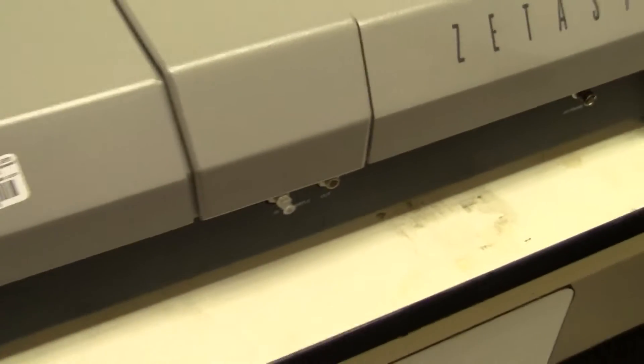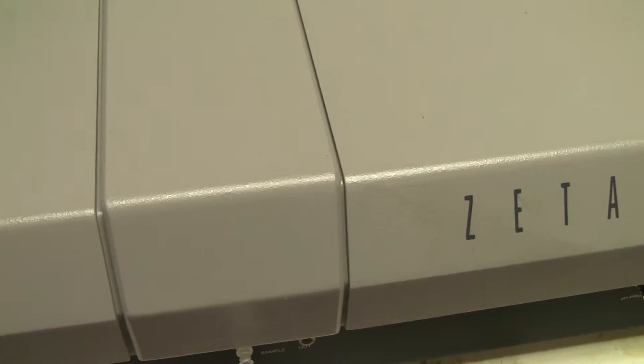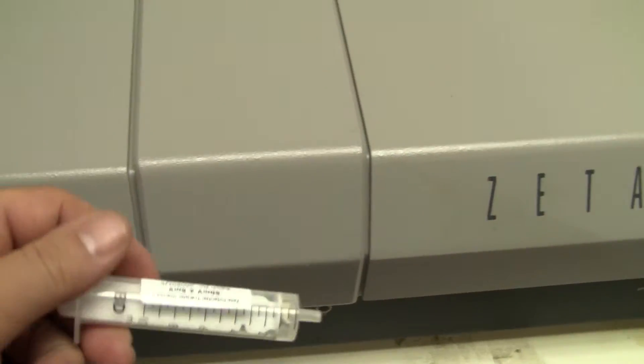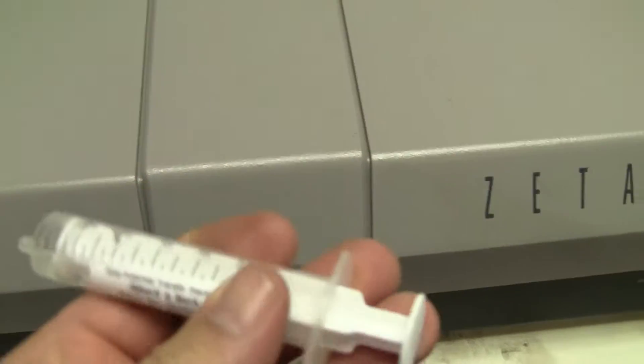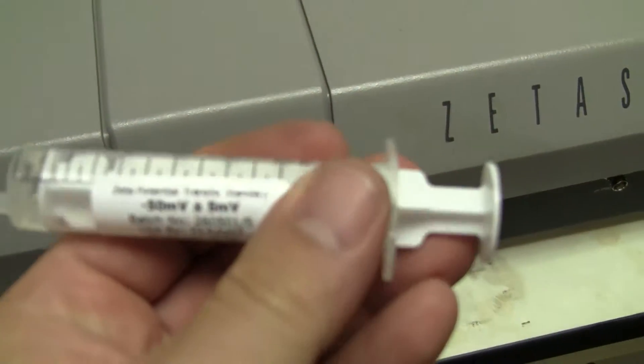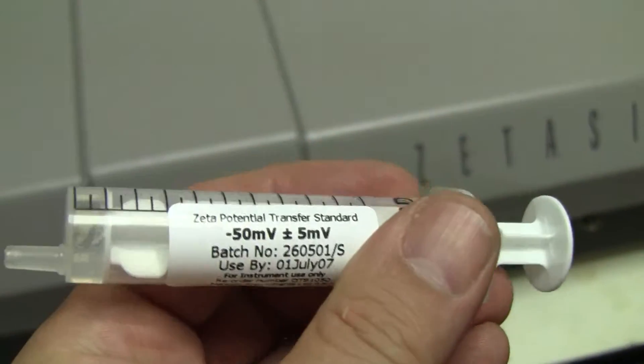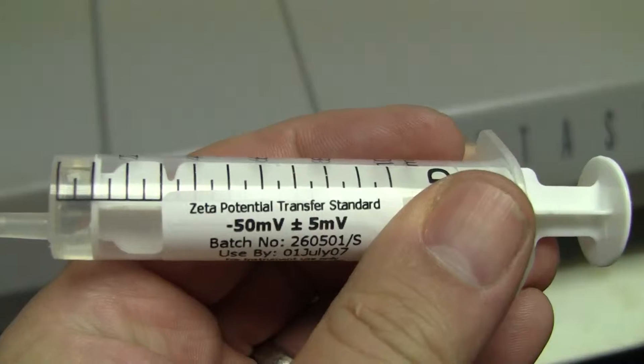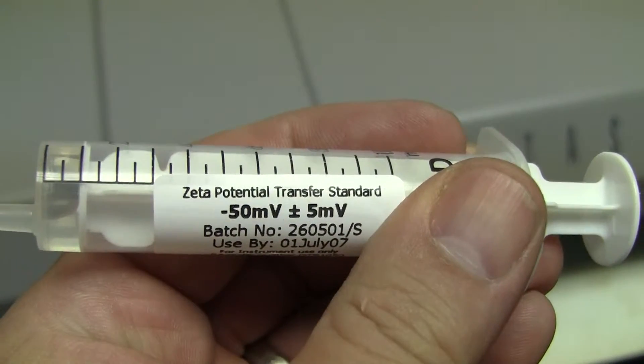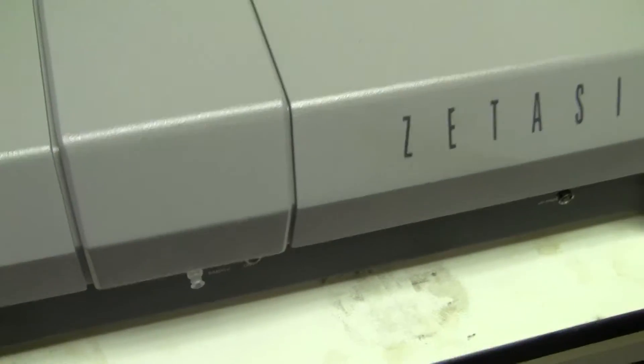The sample was injected right here in the front, as we're waiting for the results, by taking a syringe and shooting it in. The sample was an outdated sample, but it worked for this.